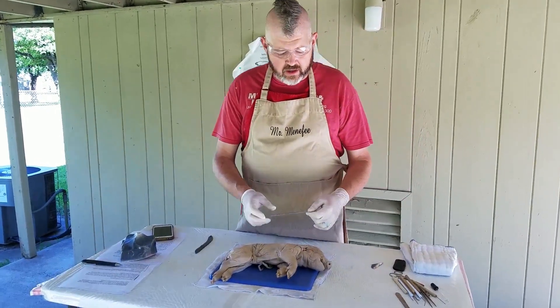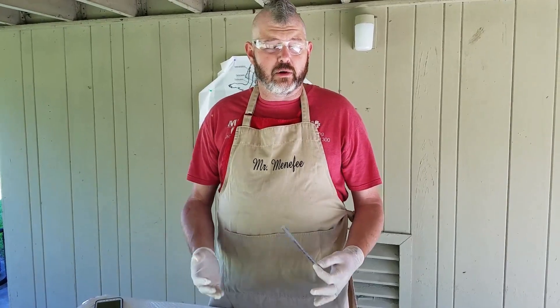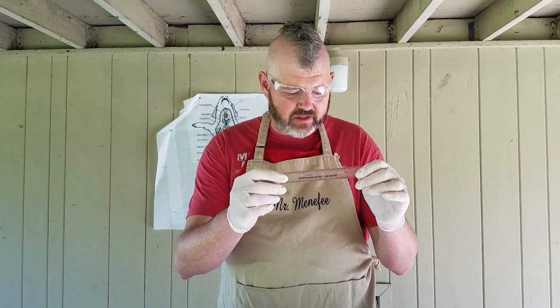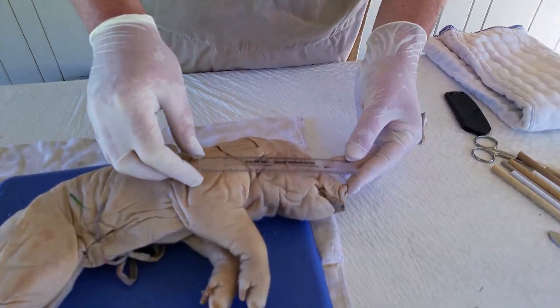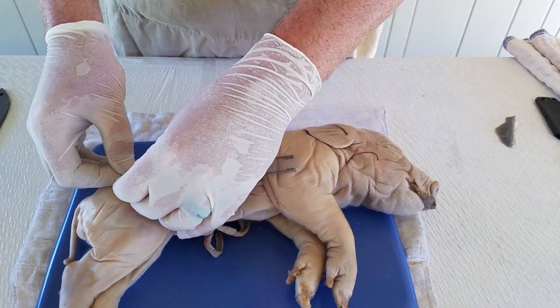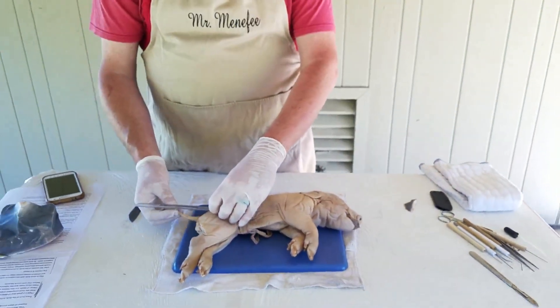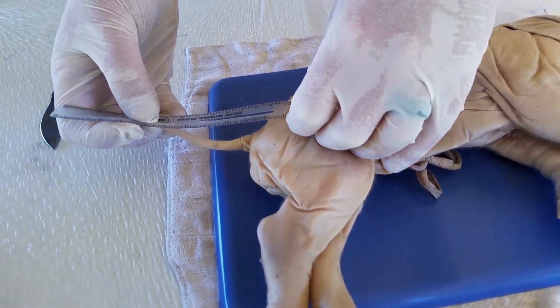Step two. We've taken a look for everything we need to do. We're going to follow the same rule of three that we did for photos. The rule of three for photos is: we take a photo of the entire item, then we come back and take a photo of everything again with a measuring device. So for our pig here, we're going to be using inches. We've got six inches here, we're up to twelve, and it looks like we're about thirteen and a half inches overall. And when we add the tail in, we bring him up to sixteen and a half inches.